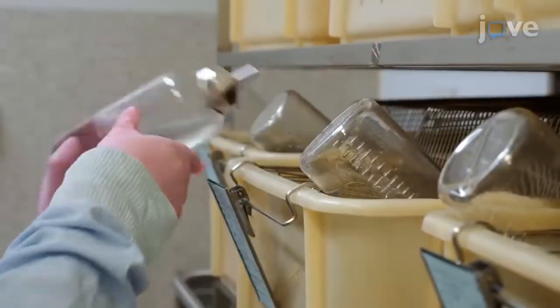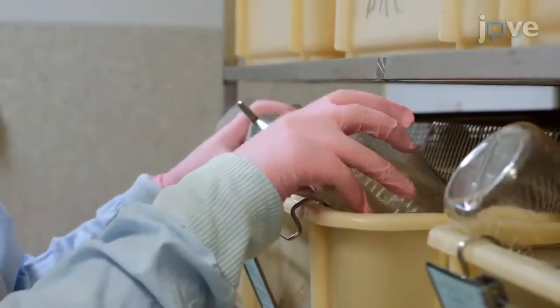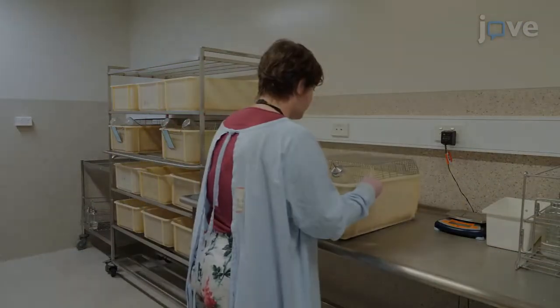To feed the chow groups, turn the water bottles around so the spouts are up and place the cage on the workspace. Remove the lid.